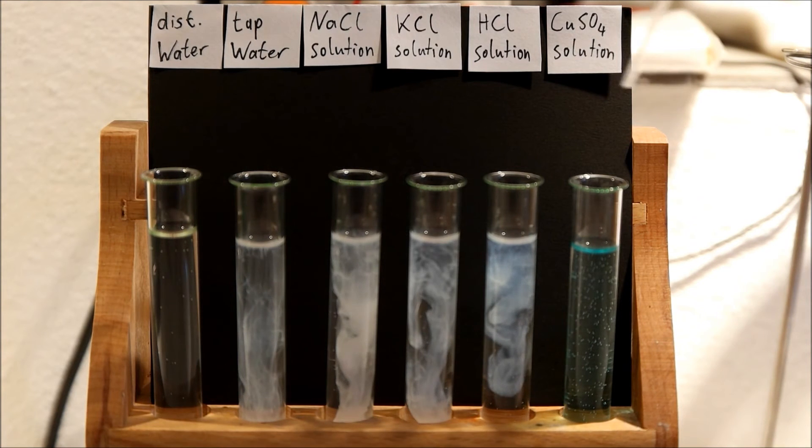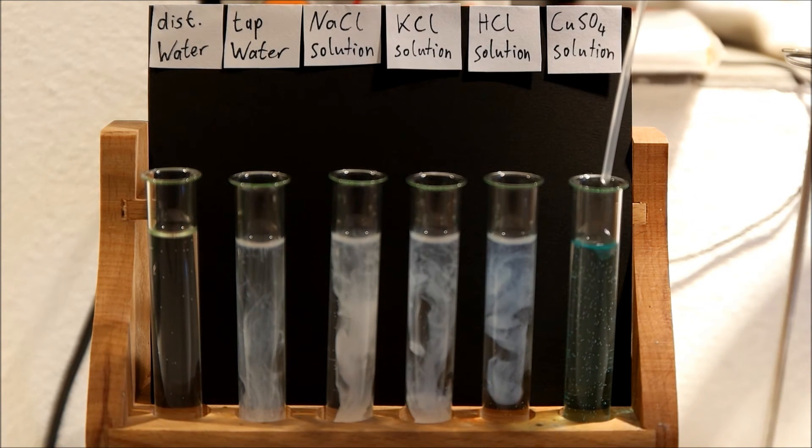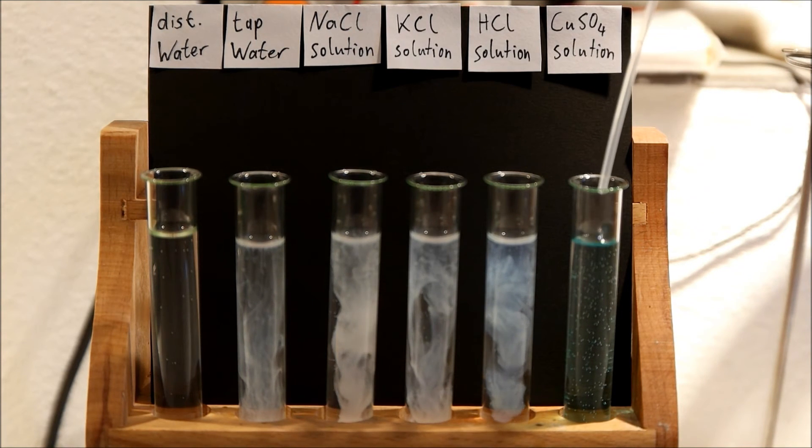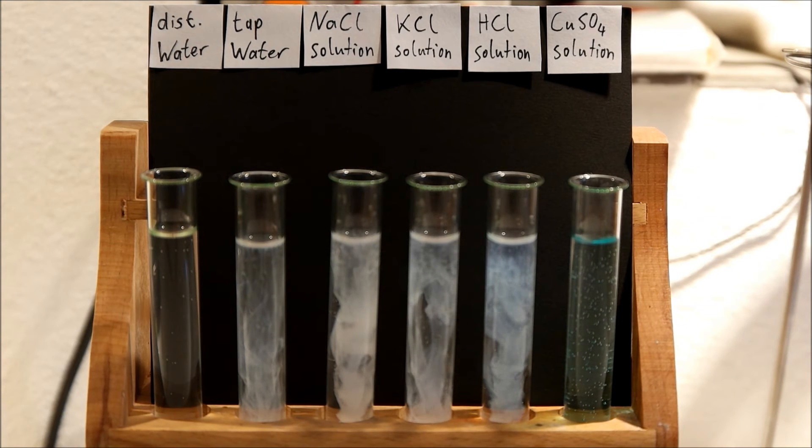But in the copper sulfate solution nothing happens, because there is no chloride in it. It is sulfate, and this doesn't make a salt with silver nitrate which is insoluble.